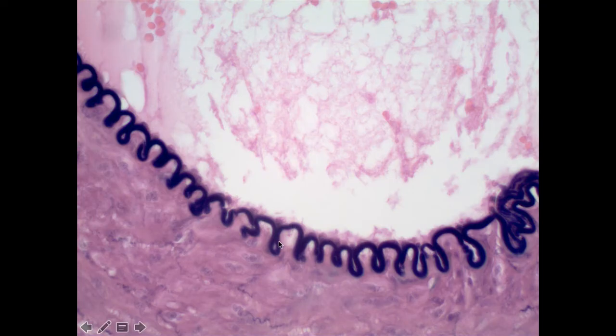Now, if you'll notice in this slide, here is this very dark purple band. This is not the epithelial layer. This is some elastic tissue that we'll learn about later. We should be looking just inside that. This very thin layer, a lighter pink tissue, is the epithelial layer. Often, because it's so thin, the thing we can see is the nuclei. In certain areas, we see this bulge out a bit, and those bulges are the nuclei of that cell layer.